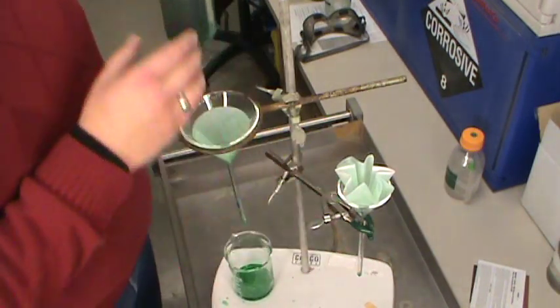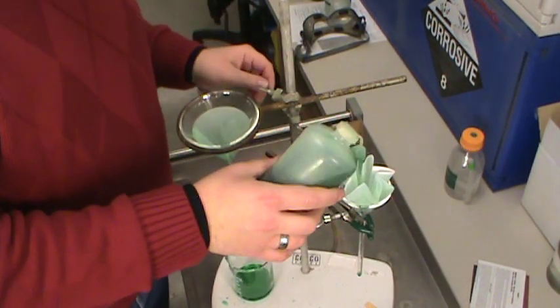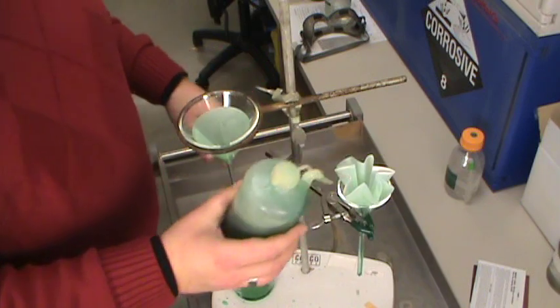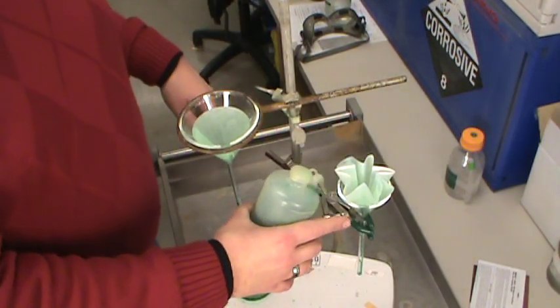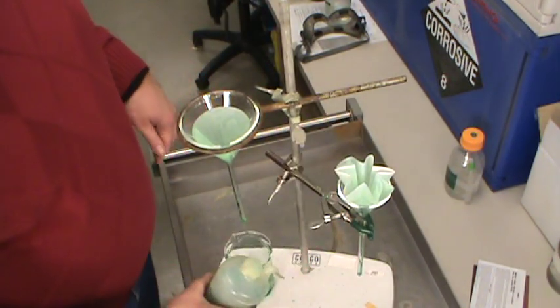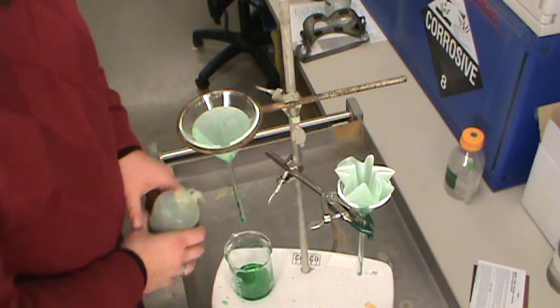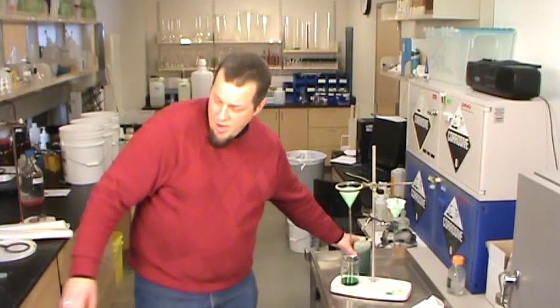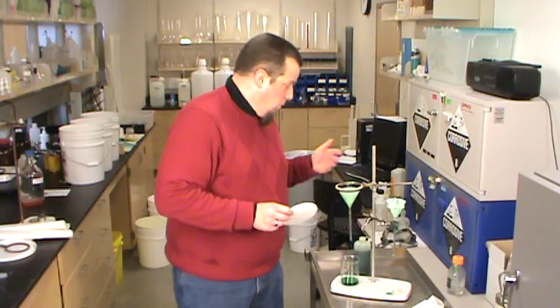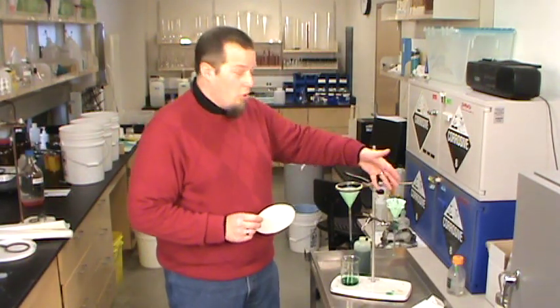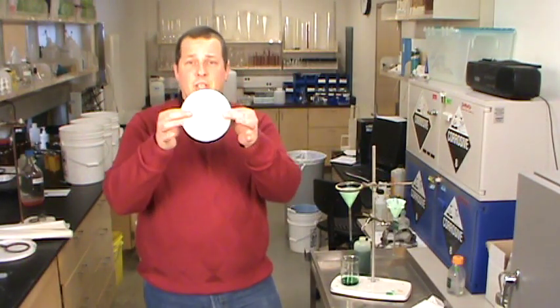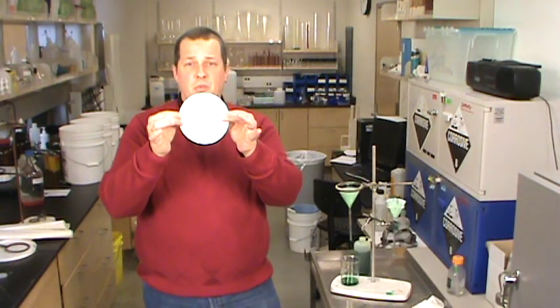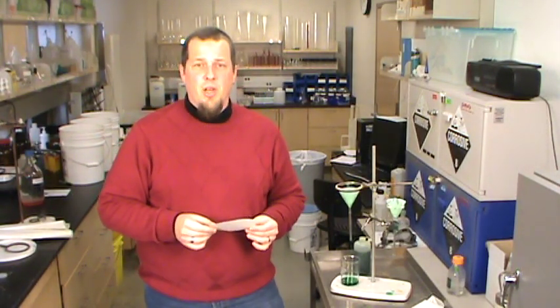With the fluted paper, well it works great, but if I miss I just sent a whole bunch of material down into my receiving container below. So there we have it - whether you do quarter fold or fluted, that's how you get a flat round piece of filter paper into a 60 degree cone shaped funnel.